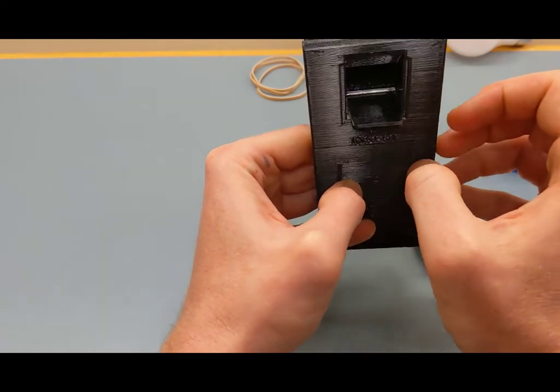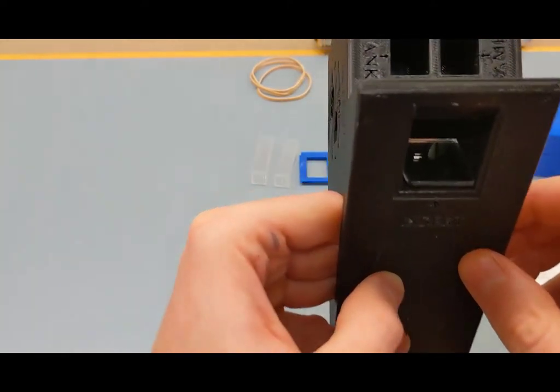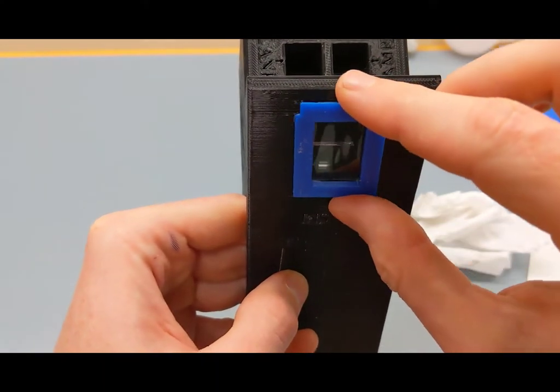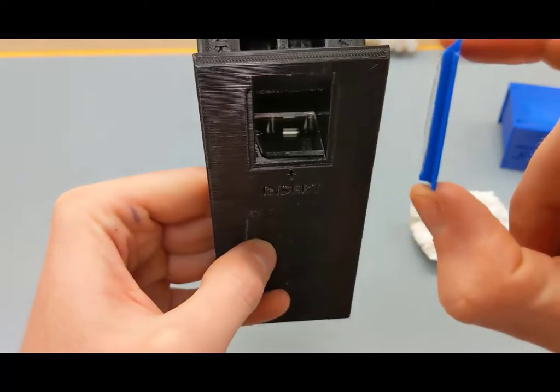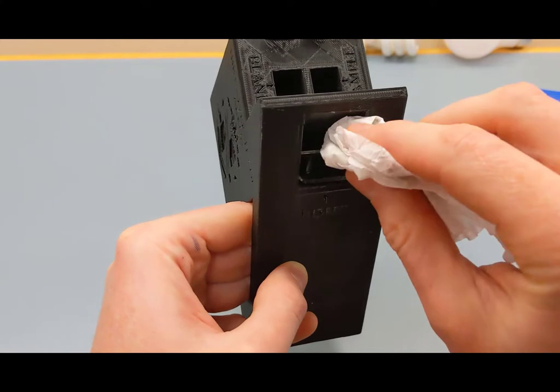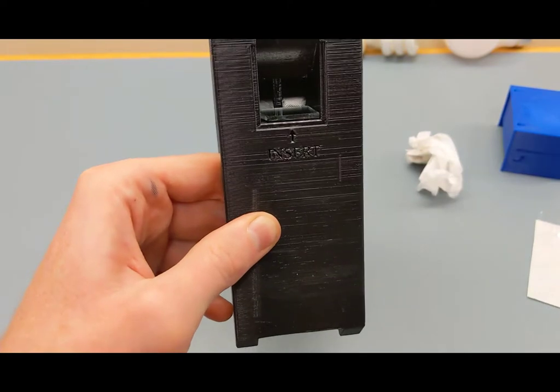Rest the mirror in place flat and carefully insert it so it's roughly five millimeters or so from the edge — maybe a little more. You want to leave enough of a lip to accommodate the piece that inserts later. Once it's positioned, use your kimwipe or gloved hand to push down and secure the mirror with the glue dot holding it in place.